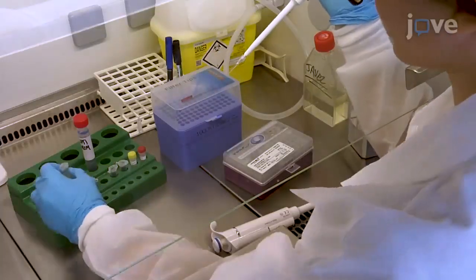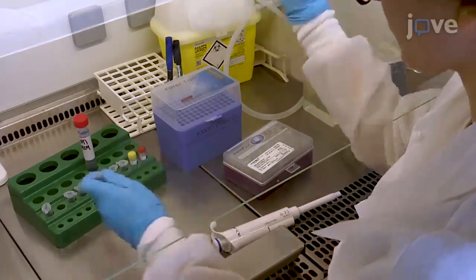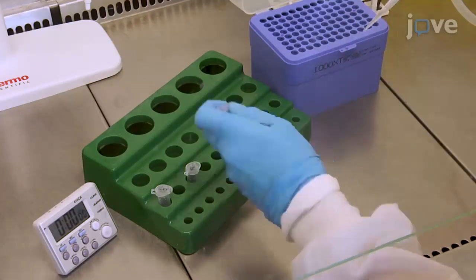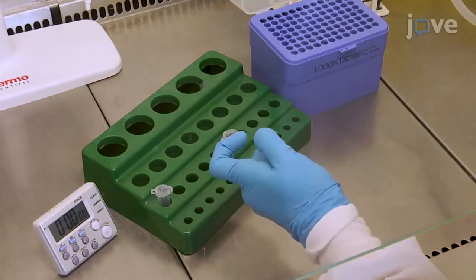Ubiquitin is one of the most conserved proteins in eukaryotic cells and is essential for their survival. Therefore, this kind of method could be applied to any eukaryotic model, from mammals to yeast. However, our lentiviral system is restricted to the study of mammalian cells.